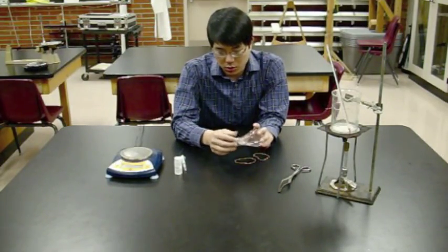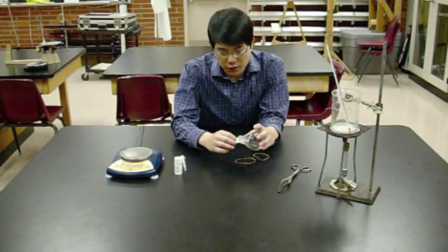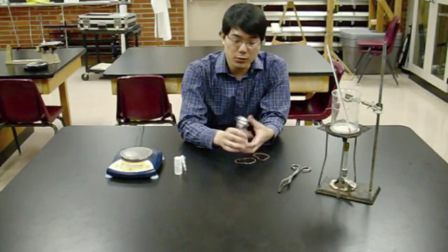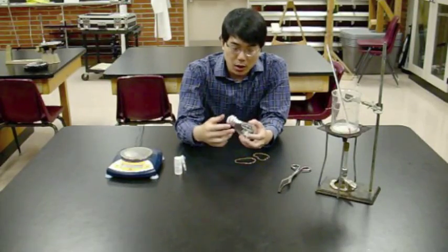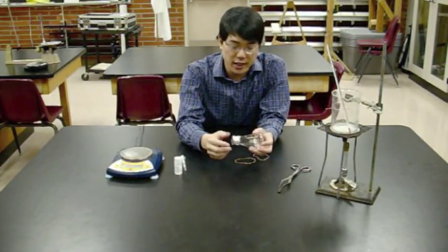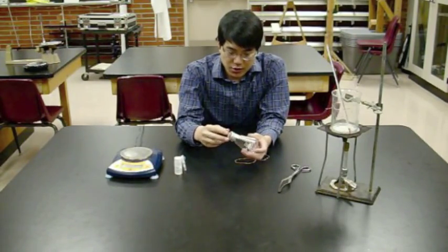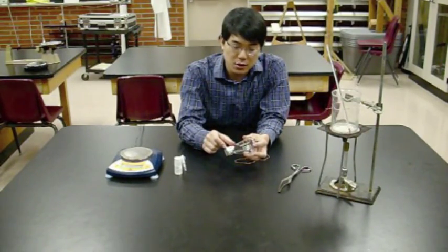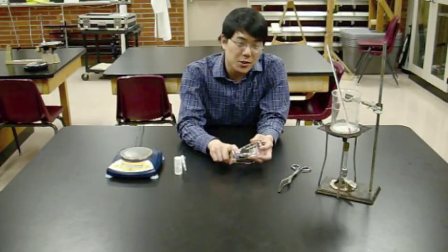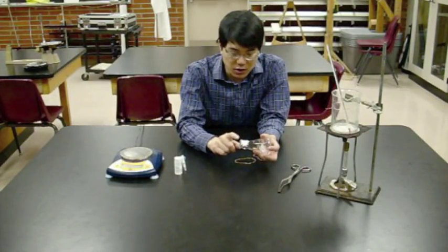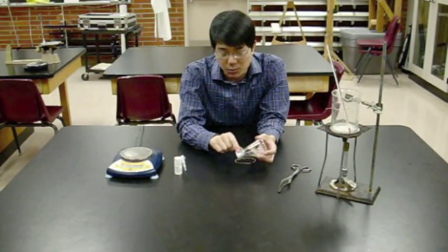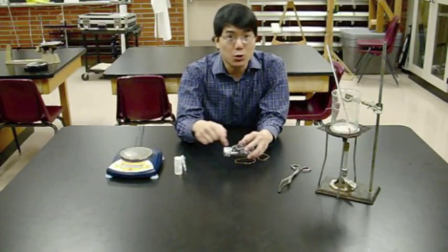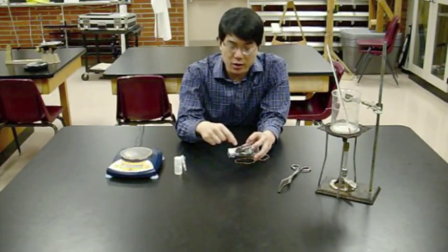One common error is that water gets trapped between the aluminum foil cap and the glass. Water on the outside is easy to wipe off, but once it's underneath the foil it's harder to remove. To reduce this error, don't let your aluminum foil extend too far down the neck. You want about enough material to cover the width of your index finger.